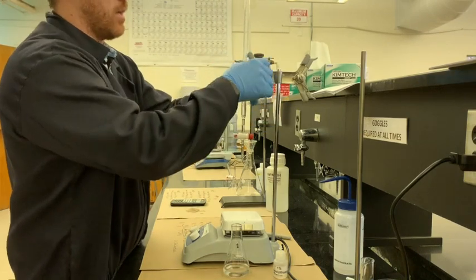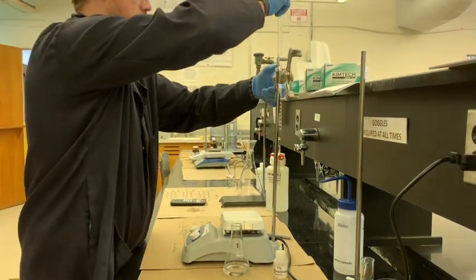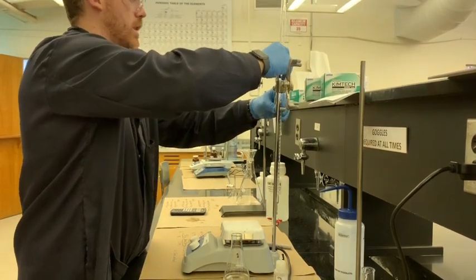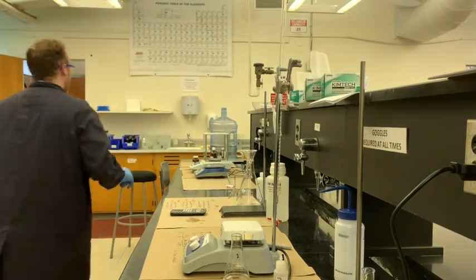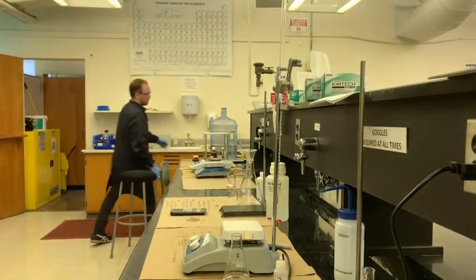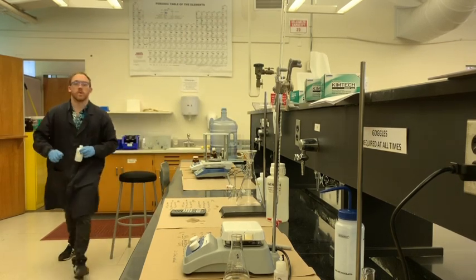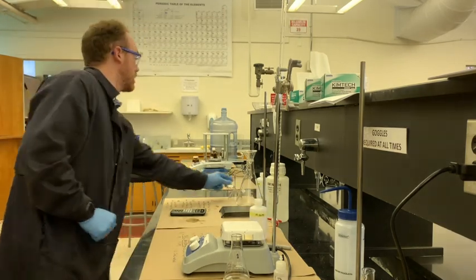and that means I'm going to take it to the side here so that I can fill it at a level that is close to eye level. You don't want to be holding the NaOH too much higher than your head. Let me just grab that real quick. Holding the NaOH over your head is going to be a very unsafe choice.